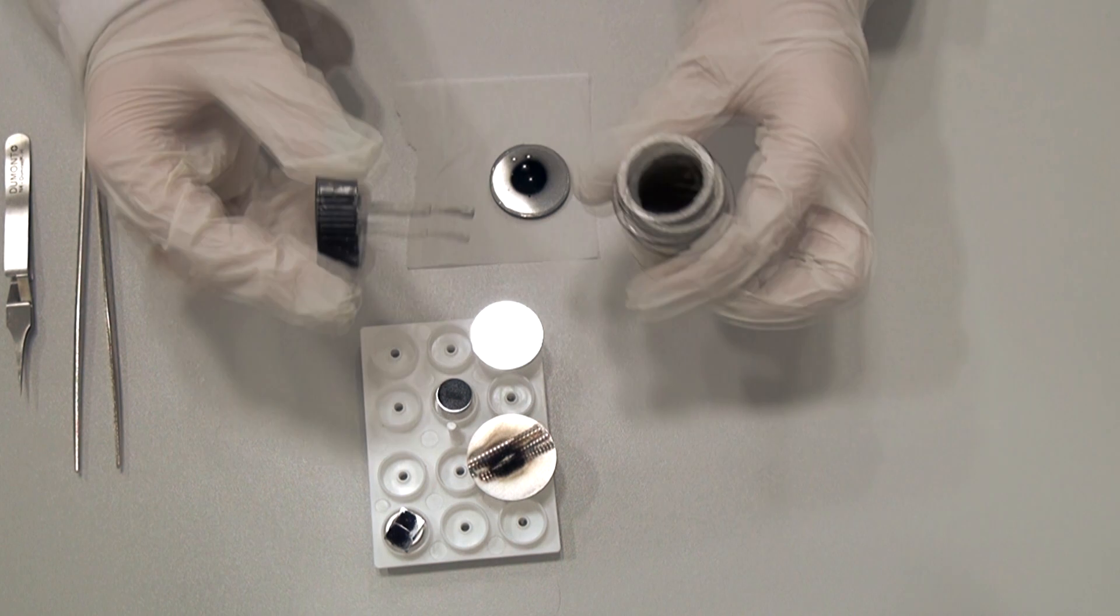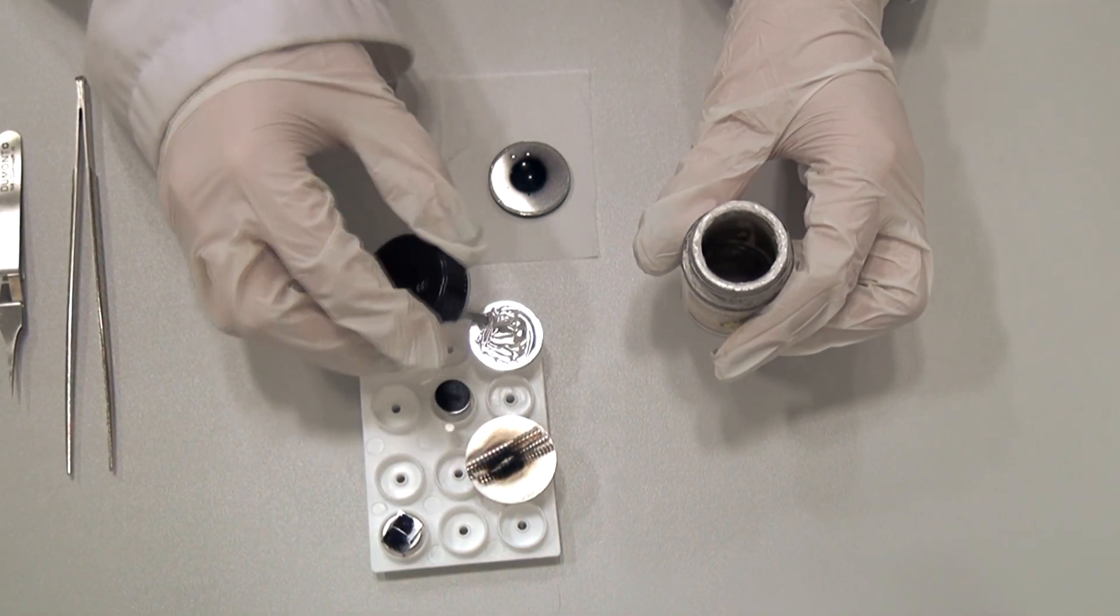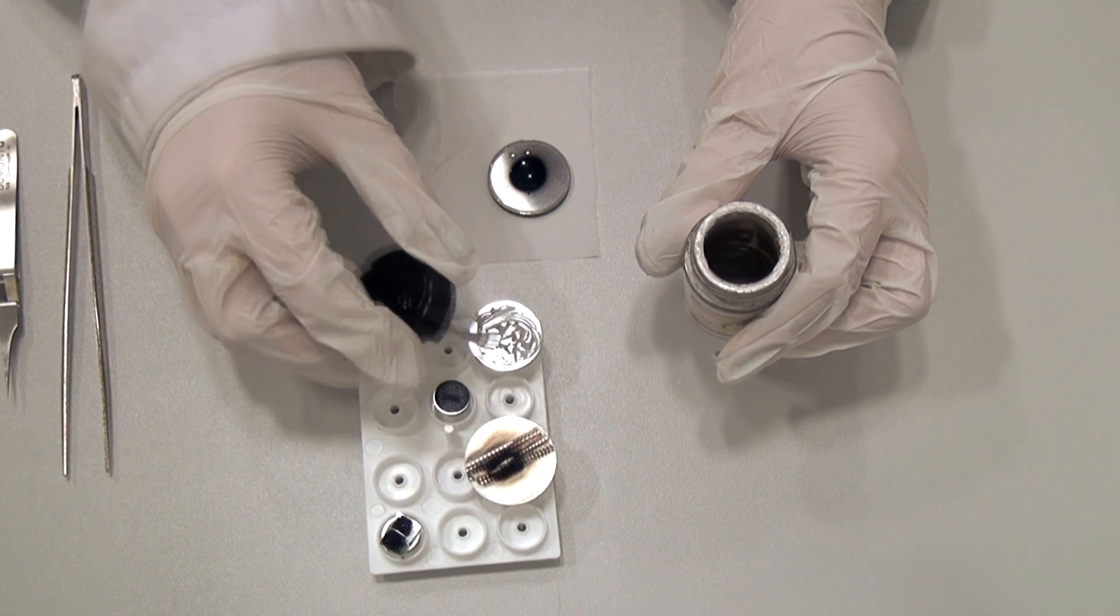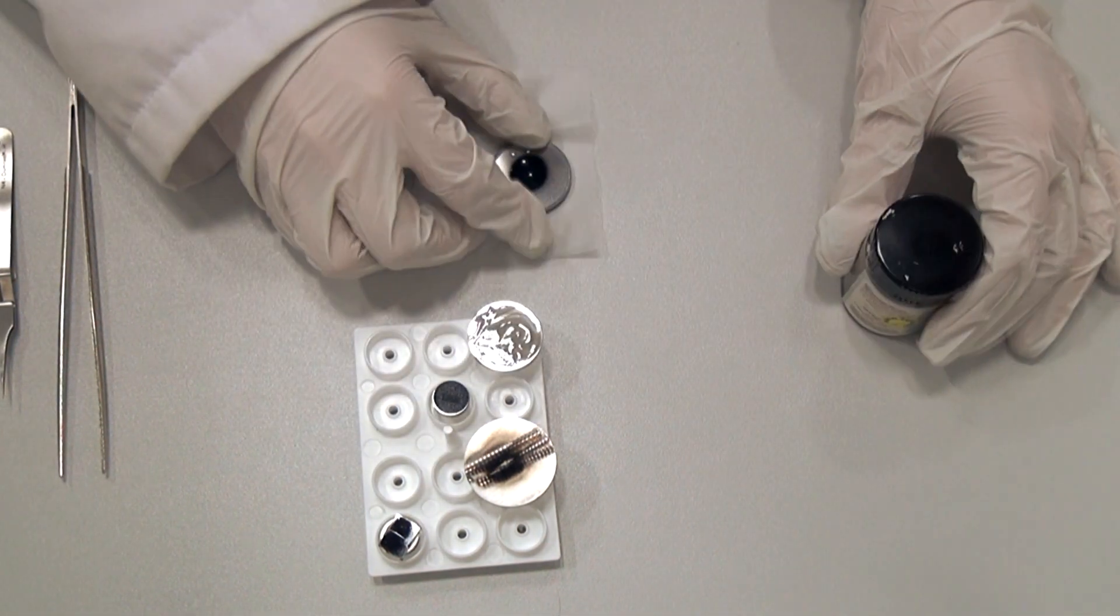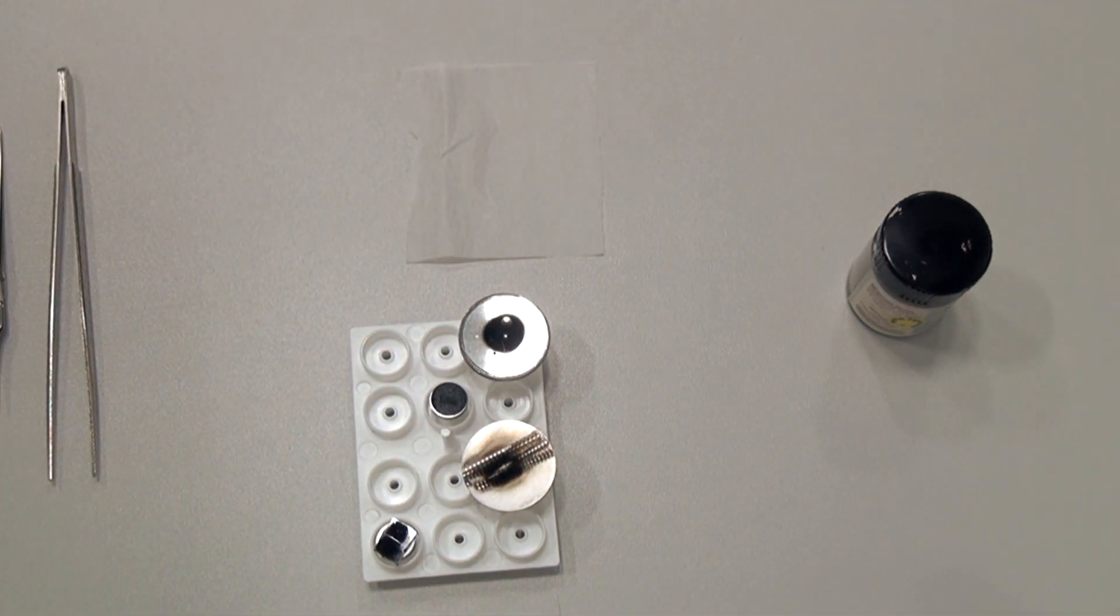In this study, we will use silver paste instead of a carbon tape to attach the sample to a mushroom-shaped holder. This allows us to obtain even higher resolution images, as the sample is kept firmly in place.